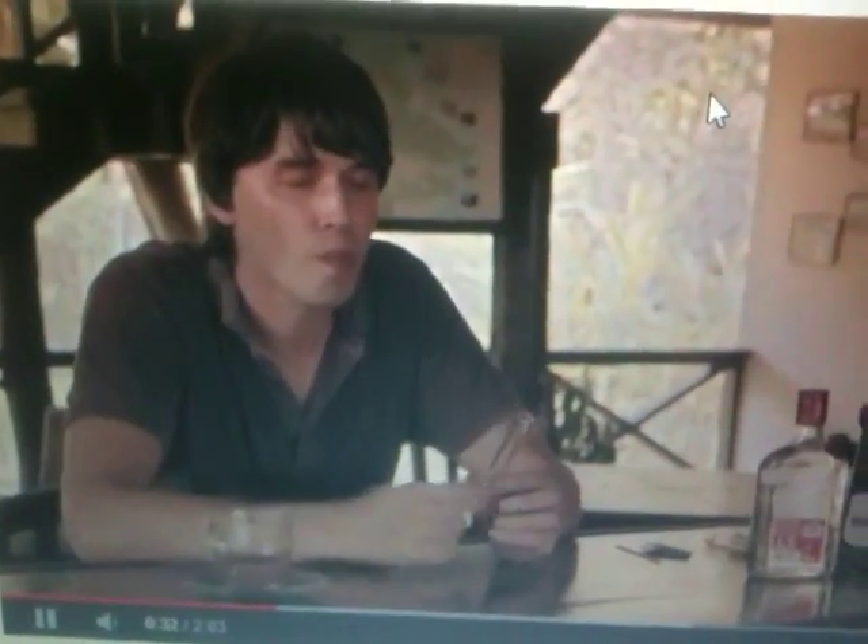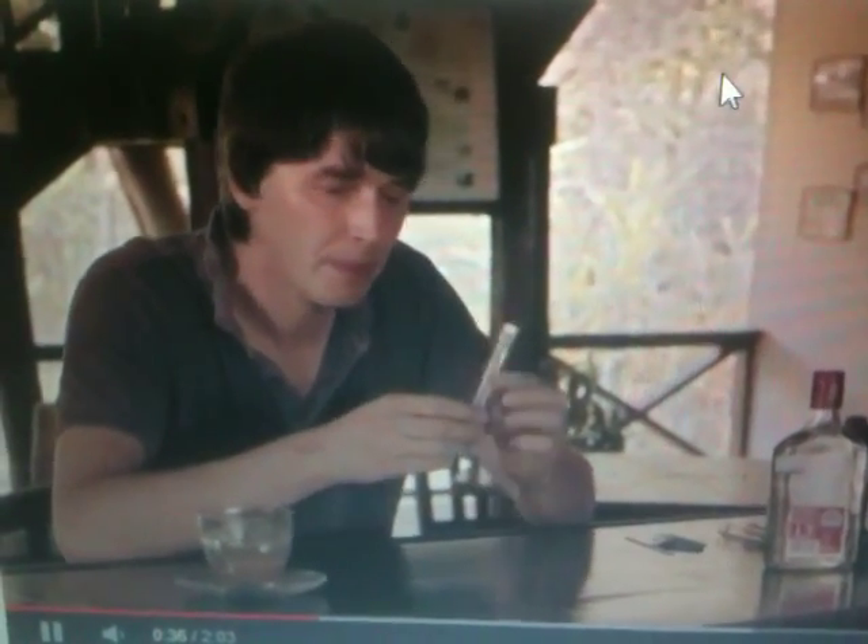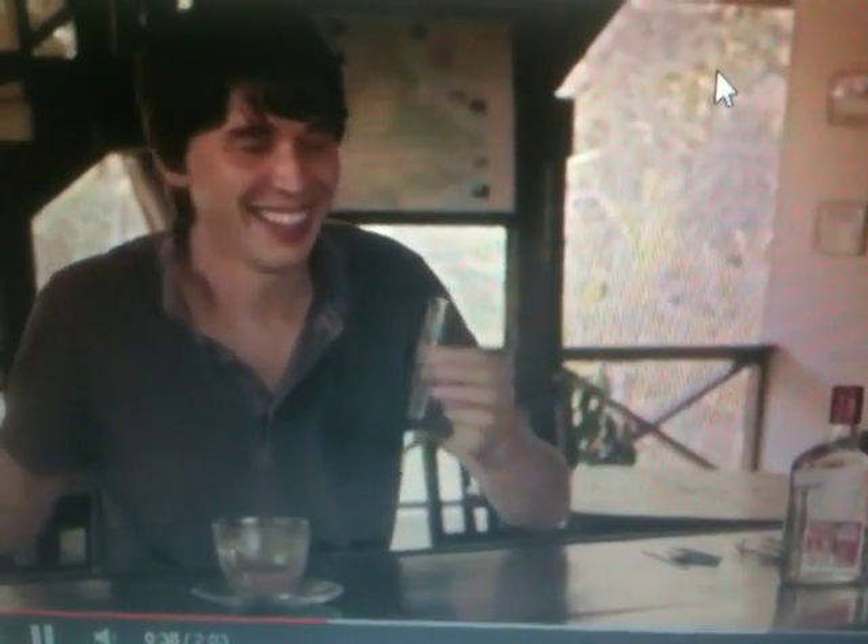To get a sample of DNA, I can just use myself. If I just swirl my tongue around on the edge of my cheek, I'll dislodge some cheek cells into my saliva. I missed the test tube. There we are. It's a physicist doing an experiment.